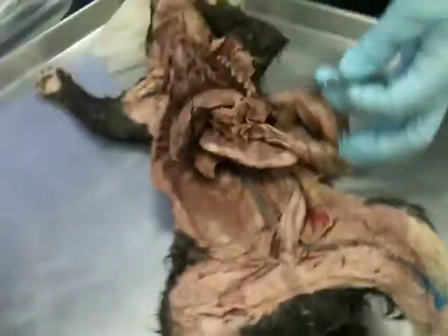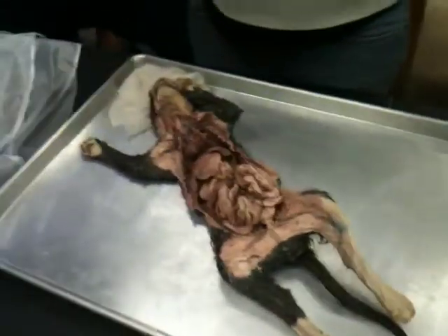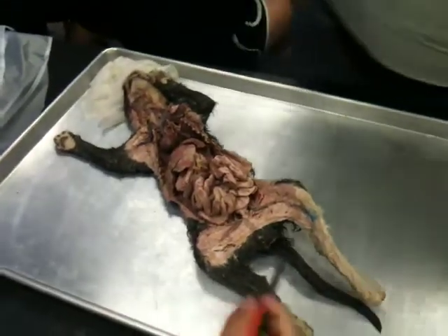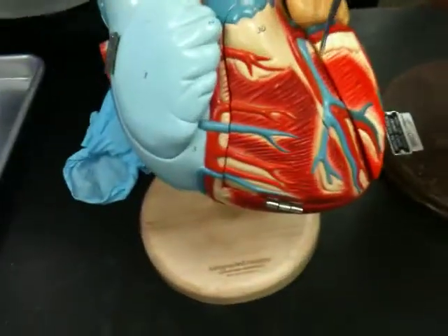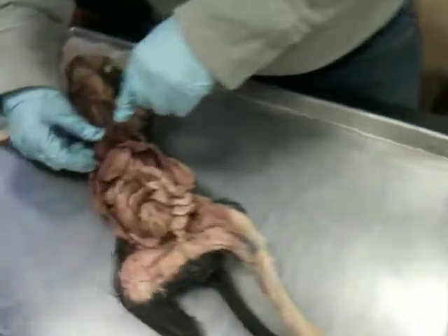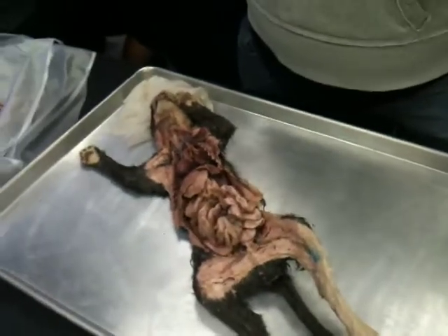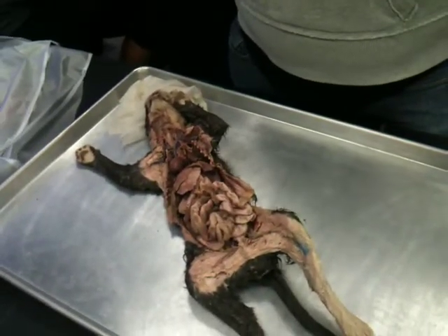Cool. The only one we didn't go over was the coronary artery, but remember those are the functional blood supply to the heart. They're actually supplying oxygen to the heart. So you can kind of see them on here where the dye has taken, but I'm more likely to ask you the coronary arteries on the model. You're not going to ask us about the tibial arteries either, right? No.